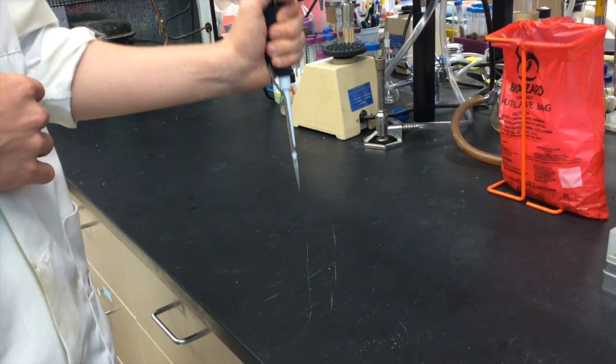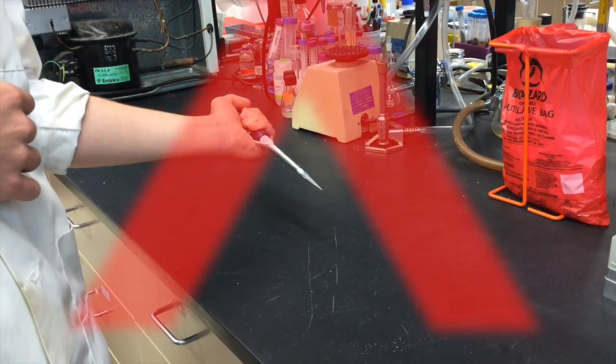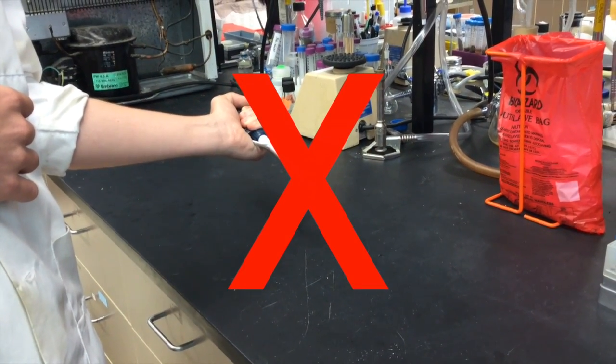Always keep the pipette vertical. Never hold it horizontally. The solution could possibly drain back into the pump, contaminating it.